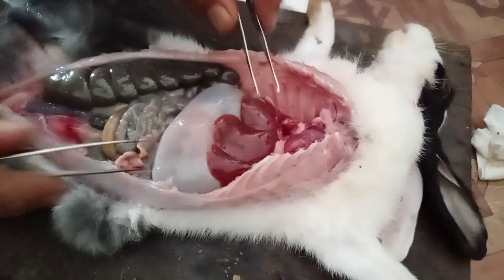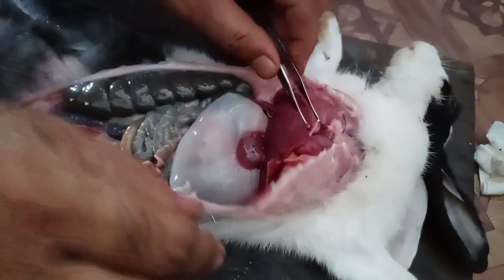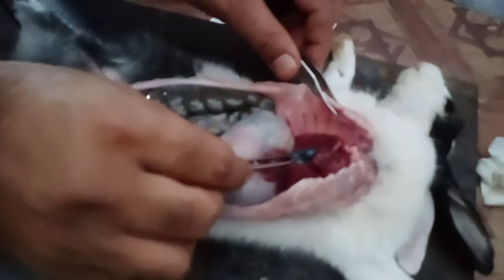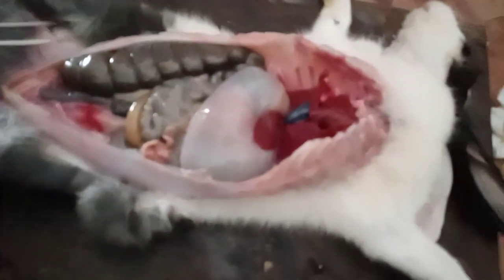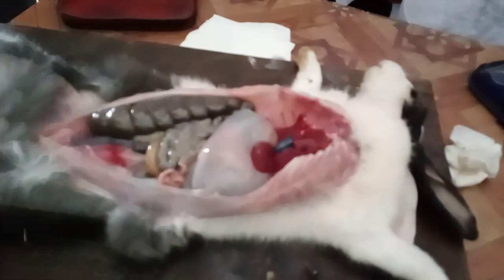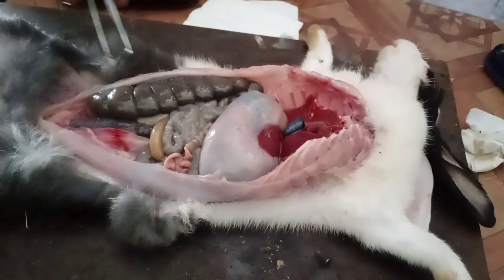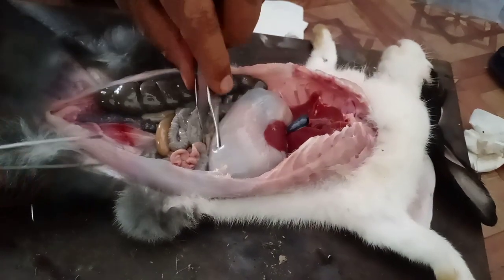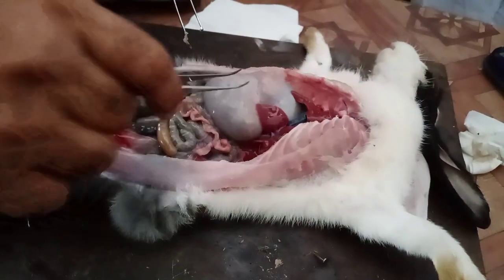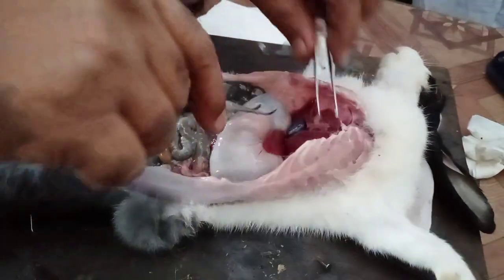This is the liver. Here is the gallbladder — this greenish structure, yes, this is the gallbladder. And this is the stomach — this one is the stomach.